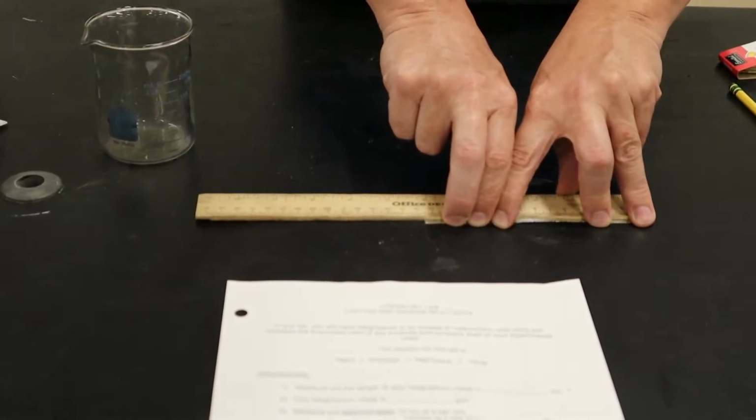All right, so the first thing we're going to do is measure out the length of our magnesium metal. We're not going to weigh it because you'll see you get a better precision. So I'm just going to do this, all right? Measure out the length. Hold on. Oh, okay. Take two.